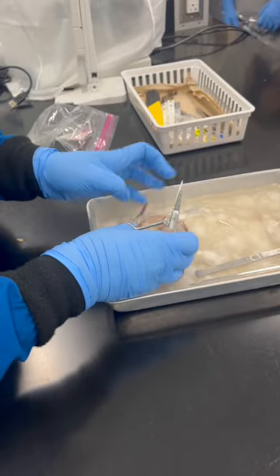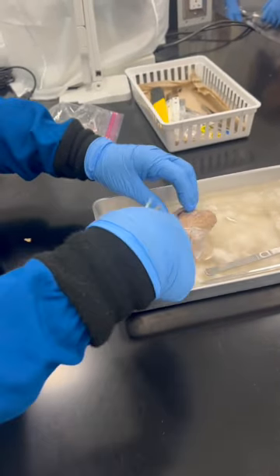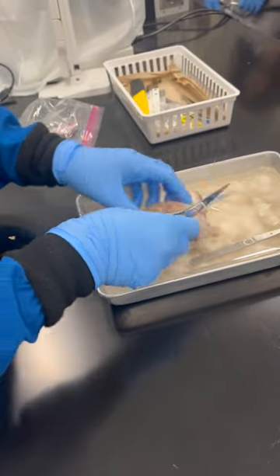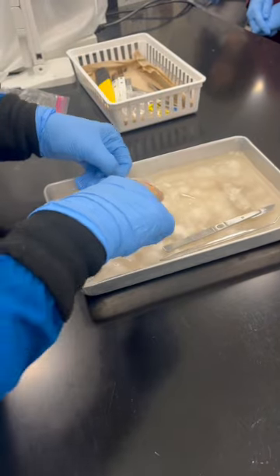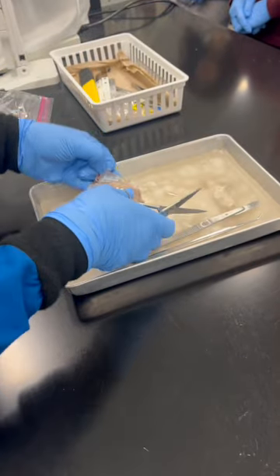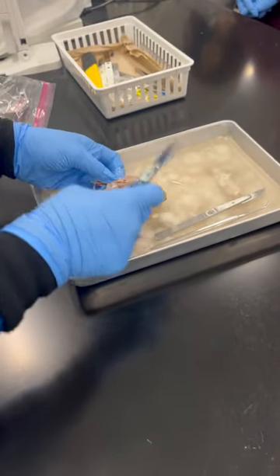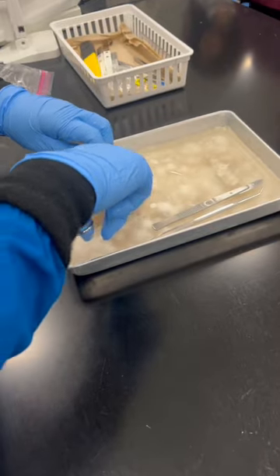Don't confuse them. Cerebrum. The cerebrum is a higher portion compared to the cerebellum. You don't want too much pressure from the cerebrum onto the cerebellum. A big area is very tough when you come to this portion, and when you dissect it, you have to be a little bit patient.